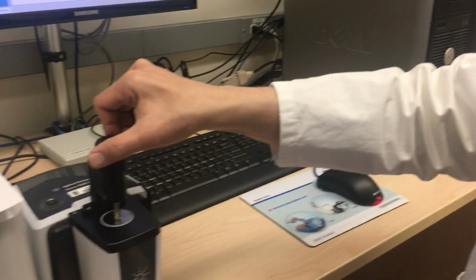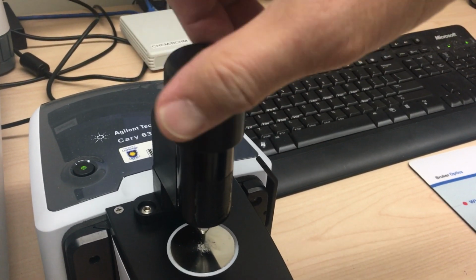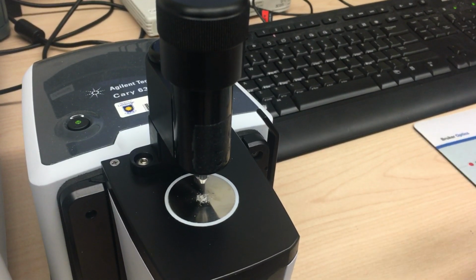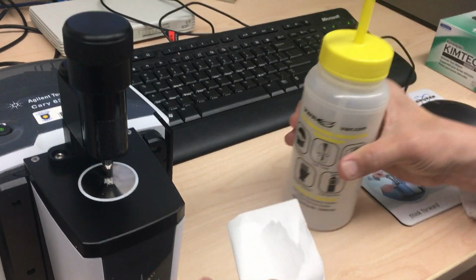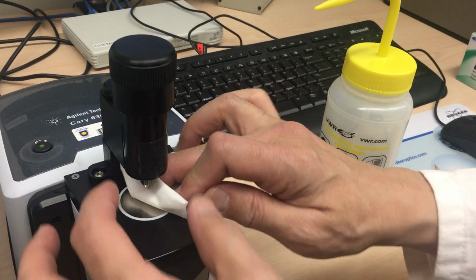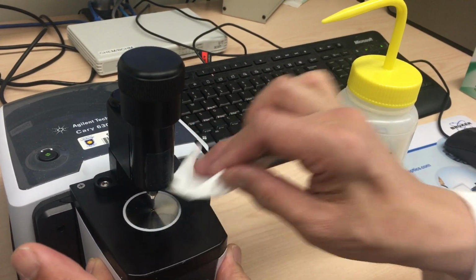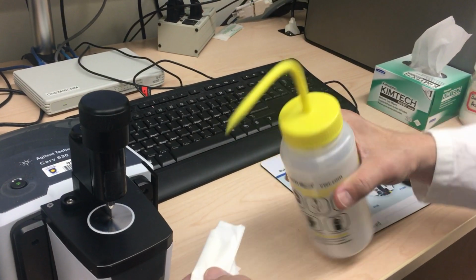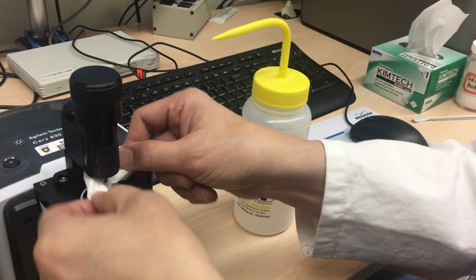So now, to finish off, we need to clean up after ourselves here. You're going to release the pressure on the hammer on your sample by turning counterclockwise until you feel a resistance, and we stop. Then take a chem wipe and some isopropyl alcohol. Squirt a little bit on the chem wipe and clean off the crystal surface, gently wiping away from the crystal. And then we're going to clean the top of the hammer with a little bit more isopropyl alcohol, gently cleaning the hammer in this fashion.